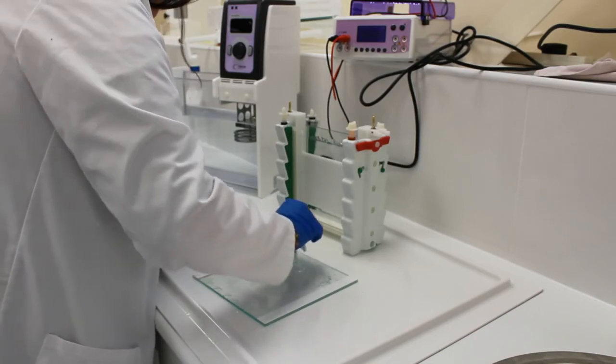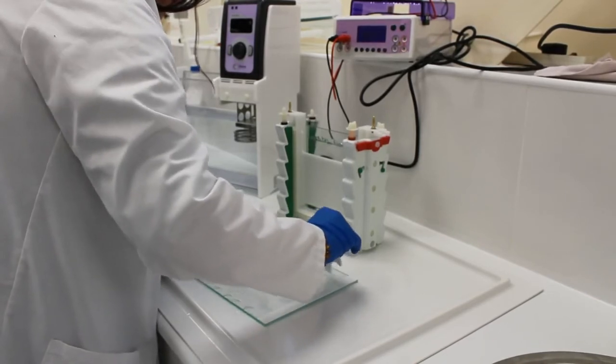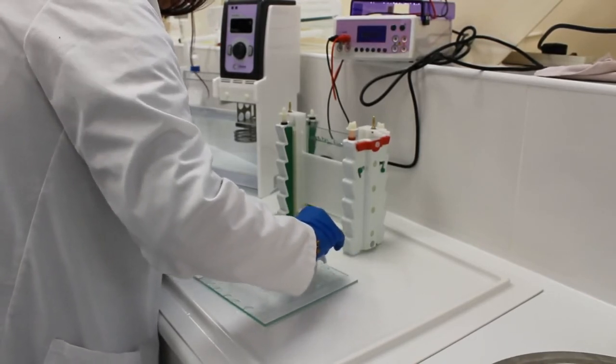Now we're going to remove the stacking gel from the top of the gel so we just end up with the main denaturing gel.